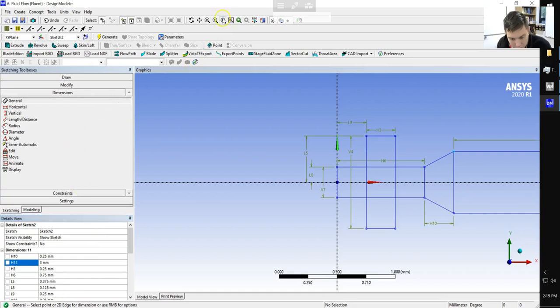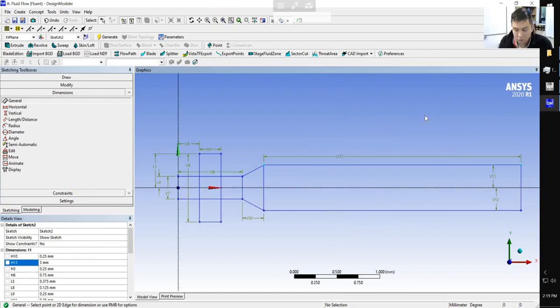Okay, so we can reposition, and this is our final geometry shape. Now, we've used the rectangles to simplify the drawing of this, but we actually have a number of extra lines that we don't need. In particular, these lines here, where we need to have fluid moving through those barriers, we need to go ahead and get rid of those.